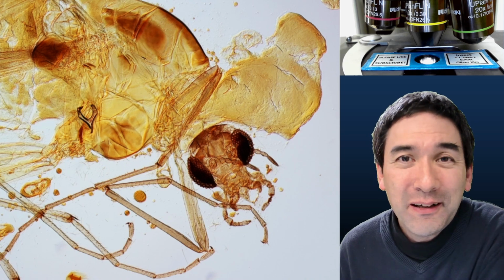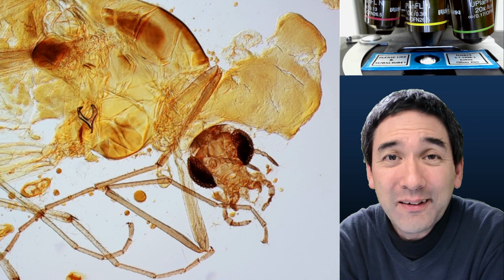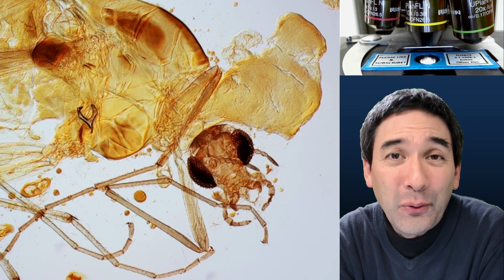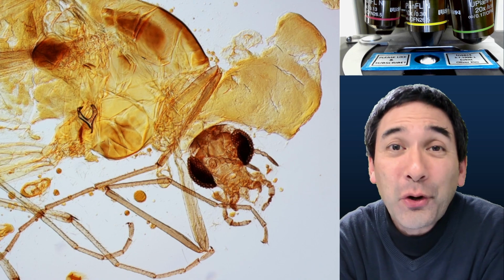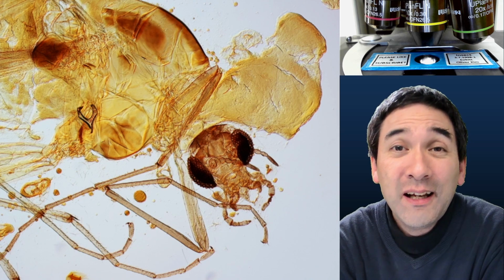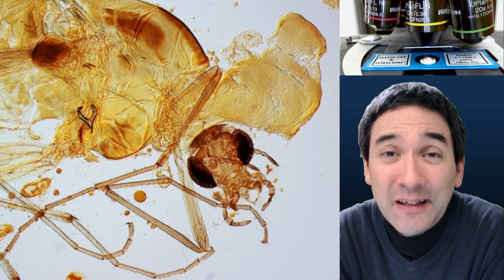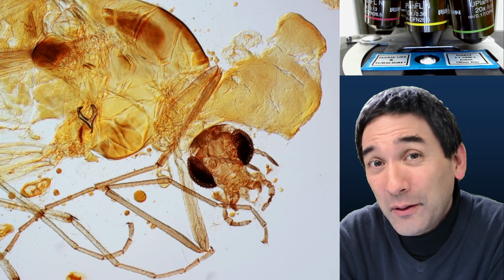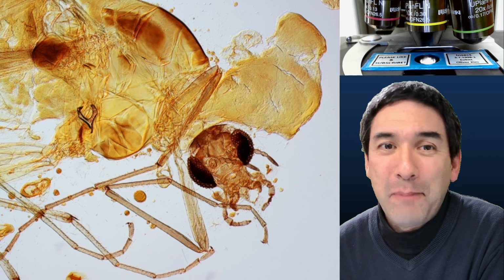Well, I've been involved in hobby microscopy now for quite a bit of time, and 25 years ago, when I bought myself my first microscope, I also started to prepare slides. And this insect here, it's a tiny little fly, was my very first specimen that I mounted. And actually now, 25 years later, looking at it under the microscope, it looks pretty bad.